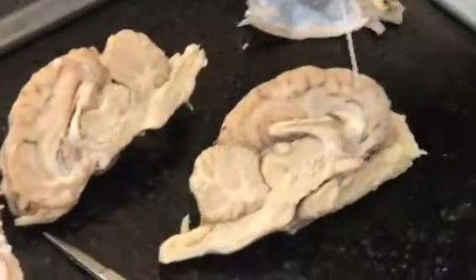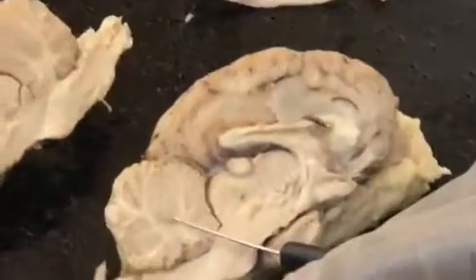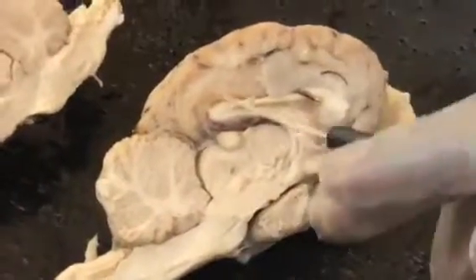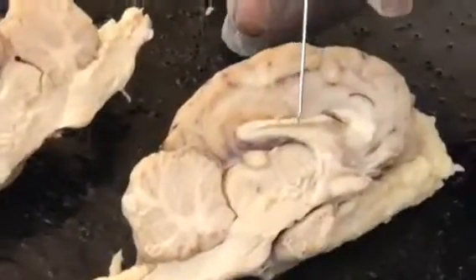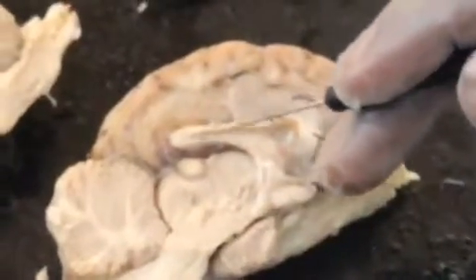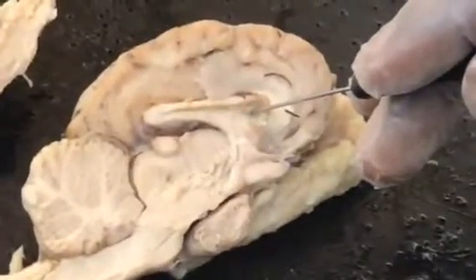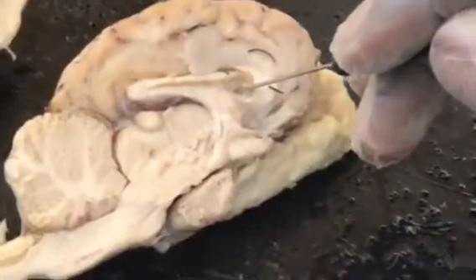What we have here is your cerebellum, which is one of the hemispheres. No, I said that wrong. This is your cerebellum. This is cerebrum, cerebellum, brainstem. This one, you see this texture is different. That is your corpus callosum. And between your corpus callosum here, this is your lateral ventricle. So your corpus callosum, lateral ventricle.